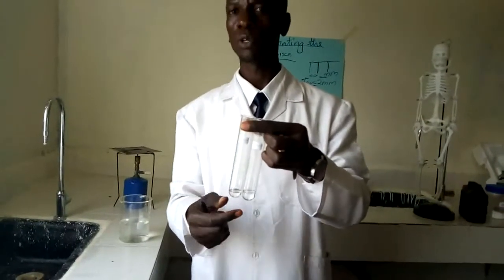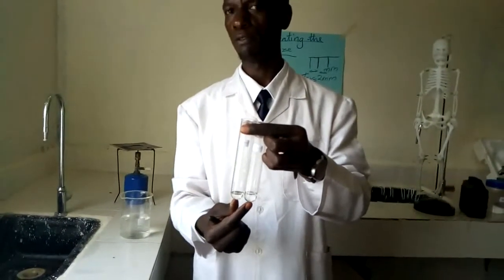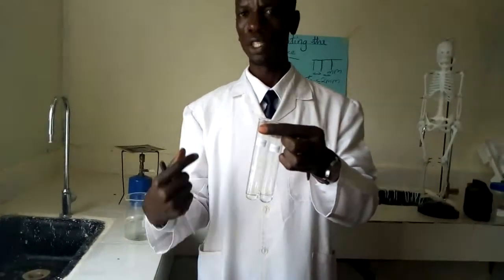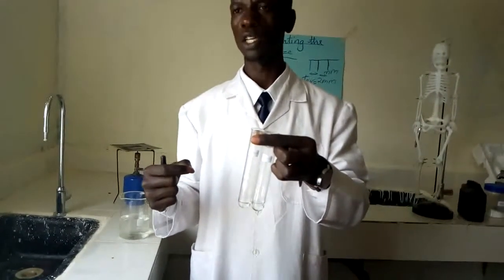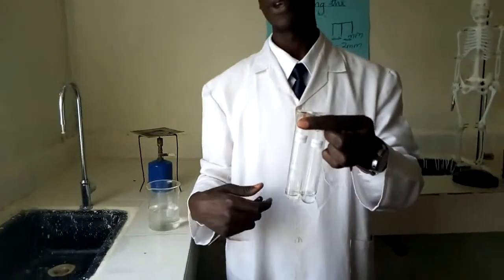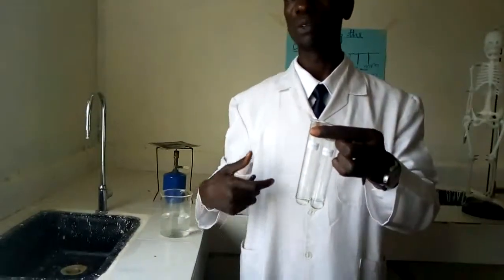The reason why we are adding sodium hydrogen carbonate is to react with the acids which would have been left in the solution. During that reaction, there is production of some small bubbles. I call them effervescence. When that effervescence is being produced, there is some hissing sound which could also be produced. We call it fizzing. So we are going to add sodium hydrogen carbonate till fizzing stops.